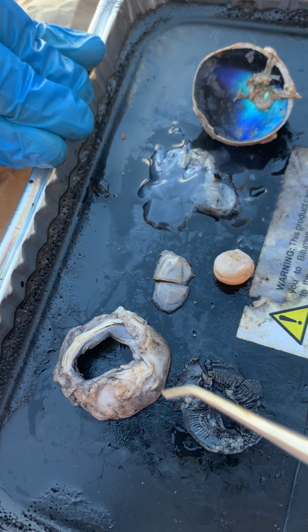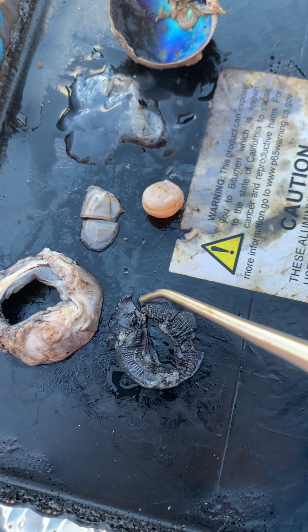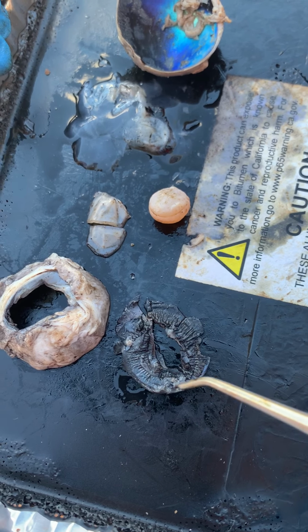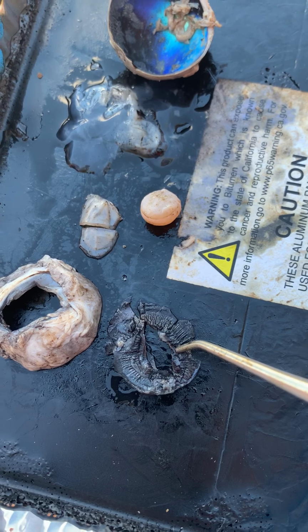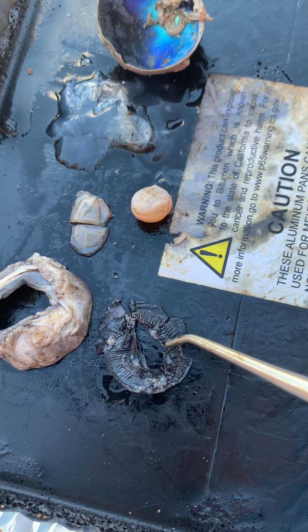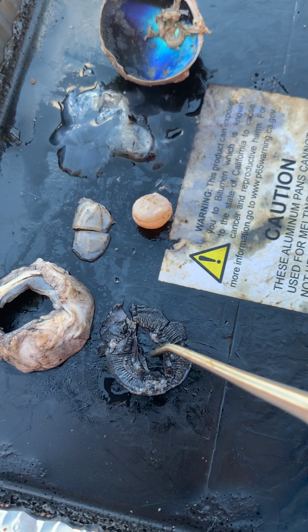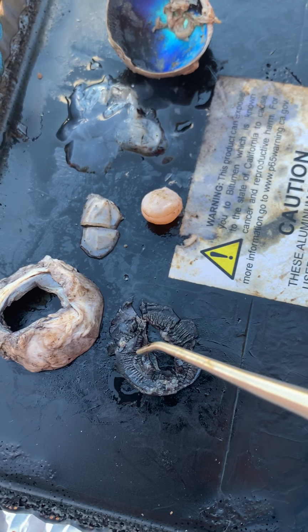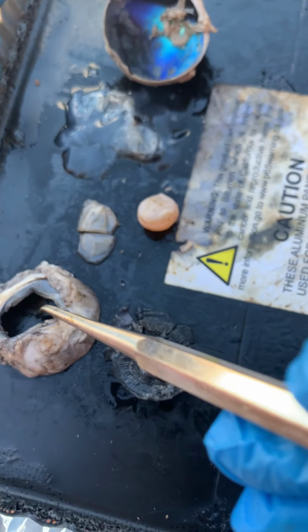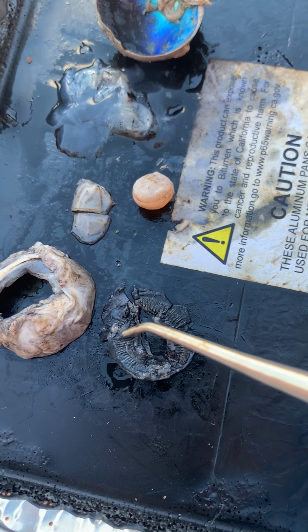Within the cornea is the iris, which functions to open and close the pupil to regulate how much light may enter the eye. The iris is also what makes your eyes look colored. The opening within the iris that changes size is called the pupil, and generally we see this as black because light cannot escape as it enters.